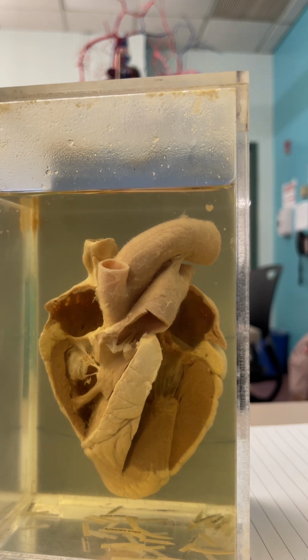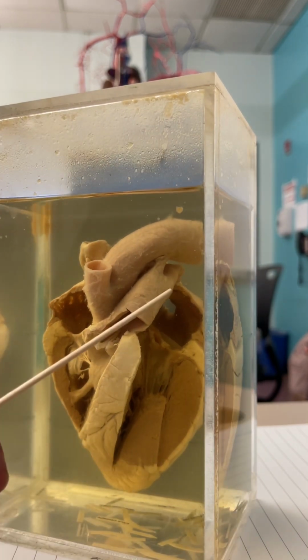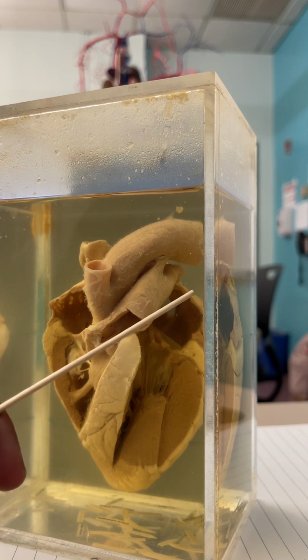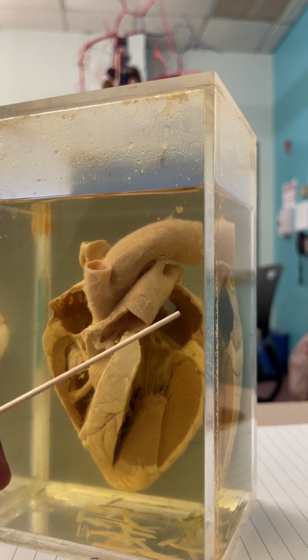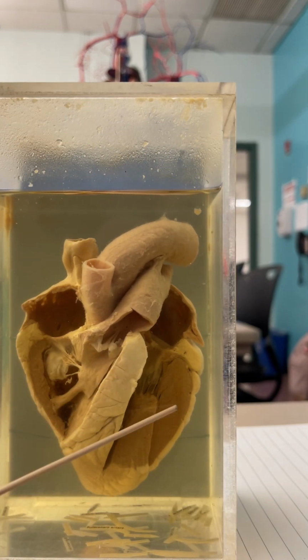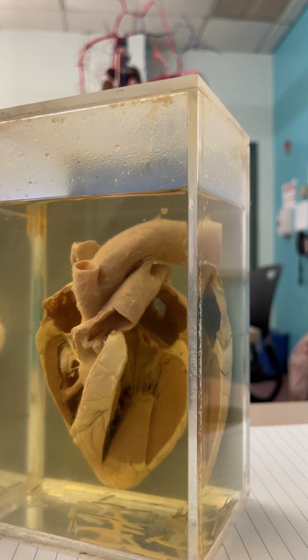Okay, blood goes to the pulmonary circuit, to the lungs, comes back to the heart. If you look back here, you can see the opening for the right pulmonary veins. The left ones would be cut out, right? But here's the left atrium. Left atrium passes into the left ventricle, the largest musculature in the left ventricle. Here, this little other piece of tissue paper looking thing, this is the bicuspid valve, and you can kind of see the papillary muscle attached to the chordae tendineae right here. It looks like little strings.